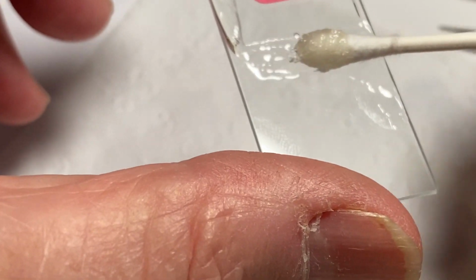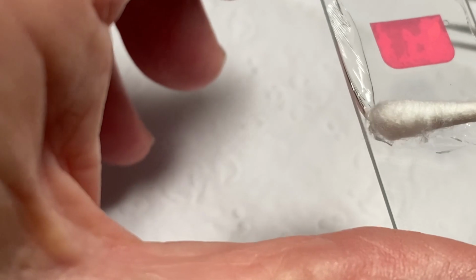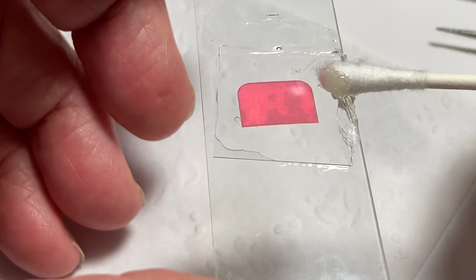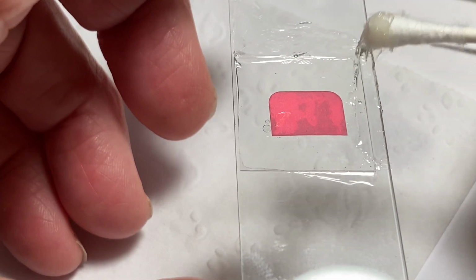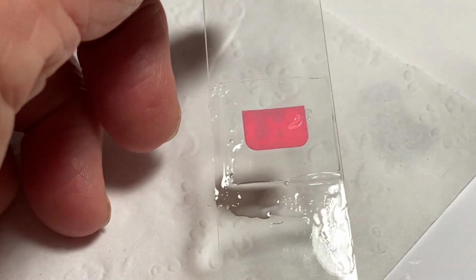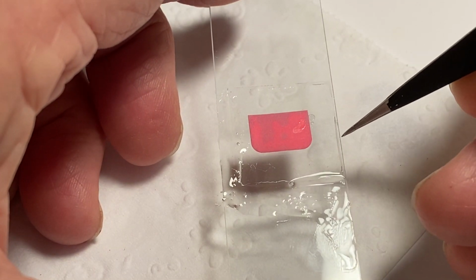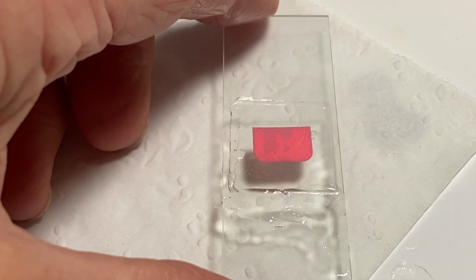Yeah, you better be very careful you don't move the cover slip. But yeah, do that. Very carefully, just because you don't want to move the cover slip. Like, let me see. Oops, I moved the cover slip, you see. That should be good enough. And then what I'm going to do, there we go. I'm going to take the cover slip a little bit. I'm going to push it in just a tad. So it's, there we go. Okay. So that's kind of centered there.